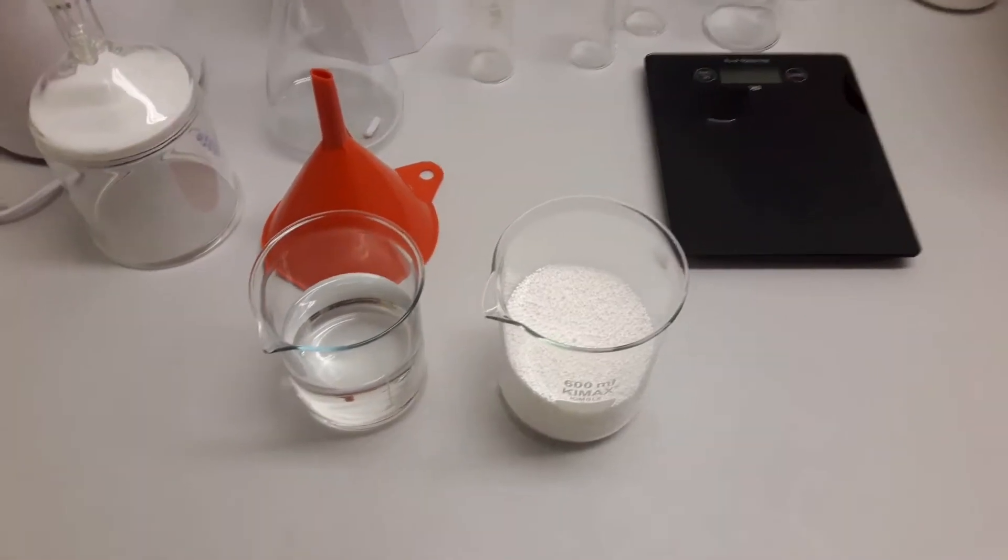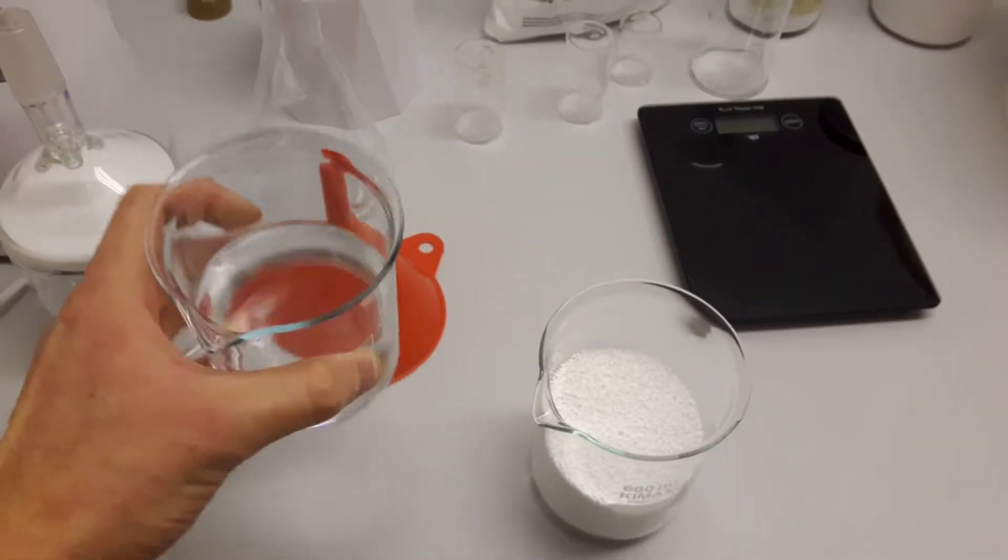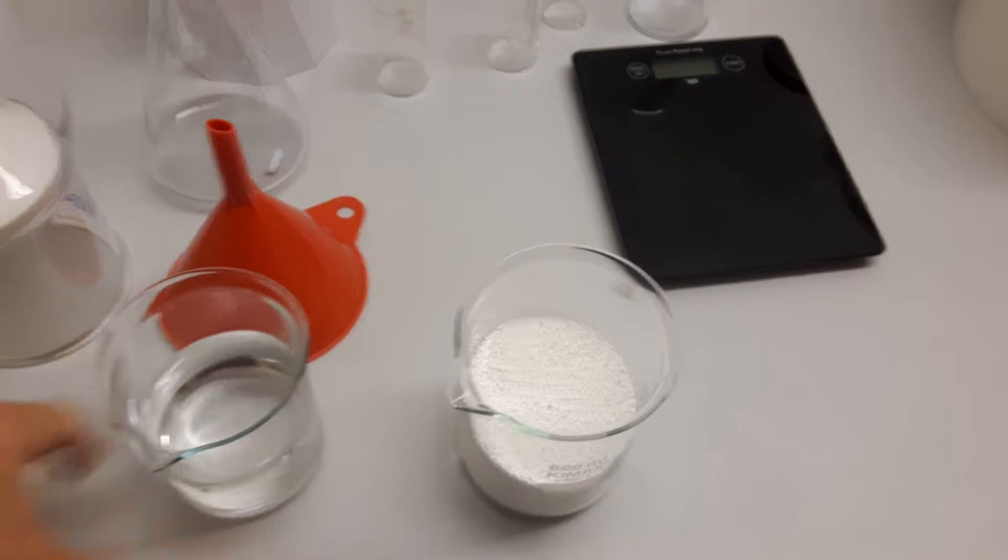Hey and welcome to a new video. This video will be about making benzoic acid from sodium benzoate.